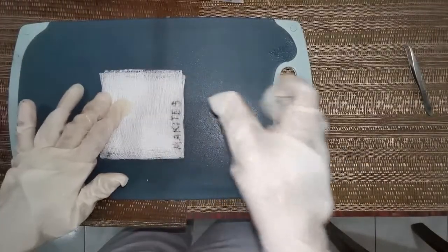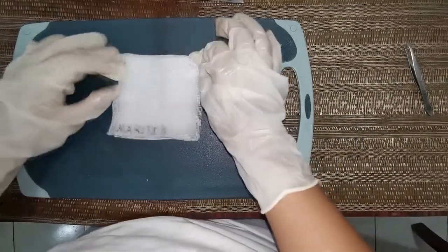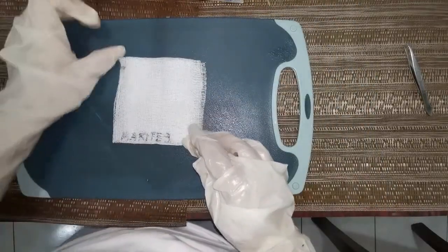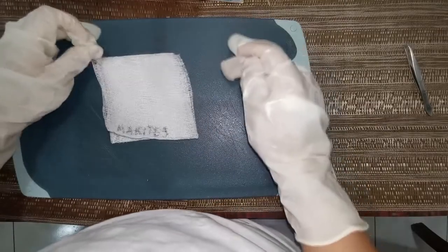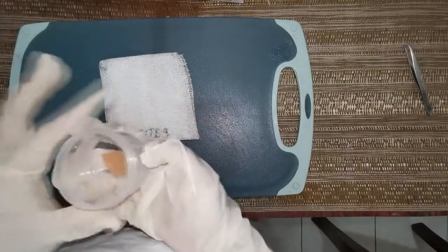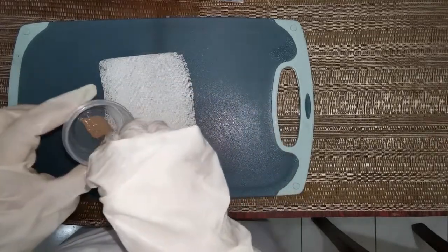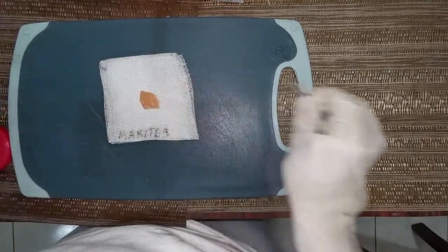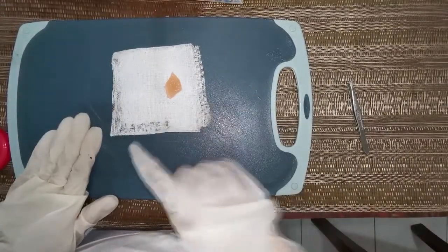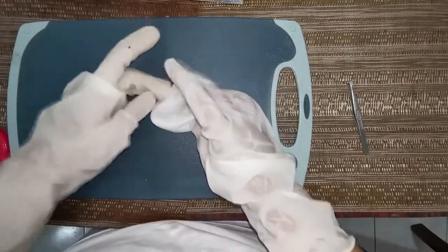Since I don't have a tissue cassette, I will be putting the specimen in a gauze pad instead. I have also opted to label the gauze pad with my code, Marites. Yeah, you can call me Tessie. I will now put the representative specimen onto the gauze pad using my tweezers for sanitary purposes. Oops! Again, since I don't have tissue cassettes, I opted to use gauze pads instead. But in a laboratory setting, tissue cassettes are totally resistant to the chemical action of histological solvents.